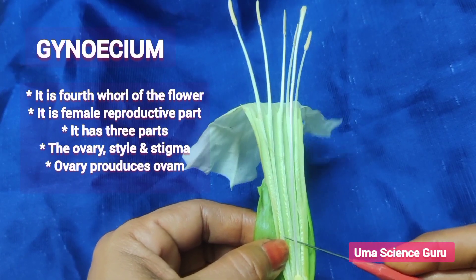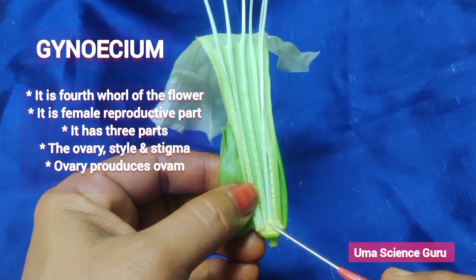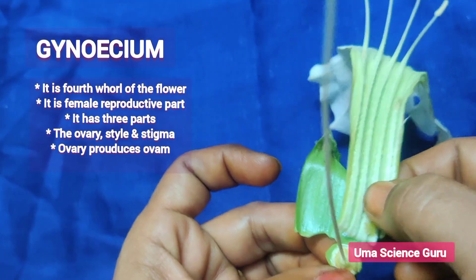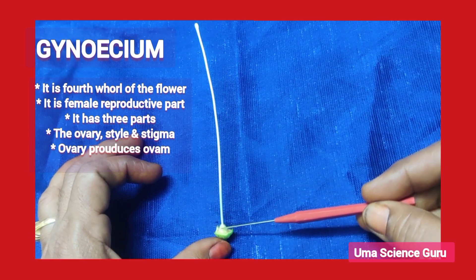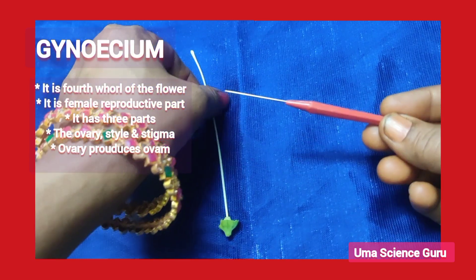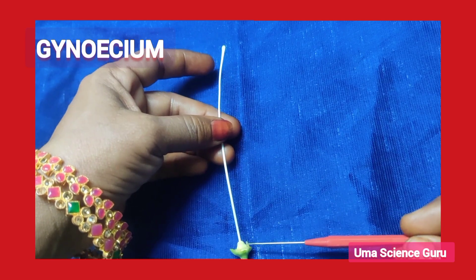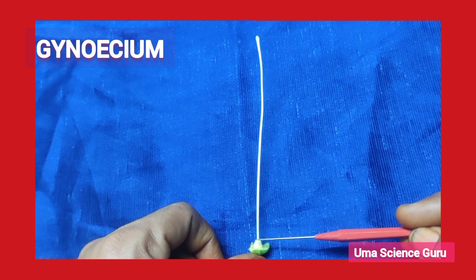Students, observe the last whorl of the flower — that is the gynoecium. It is the female reproductive part of the flower, also called the pistil or carpel. There are three parts in the gynoecium: a bulging structure seated on the thalamus is called the ovary, which continues into a fine tube-like structure called the style, with a slimy bead-like tip called the stigma. The stigma receives pollen grains, the style provides passage for male gametes, and the ovary produces eggs or female gametes.